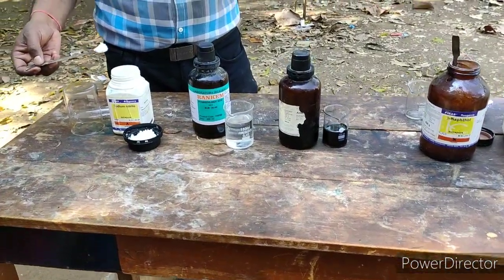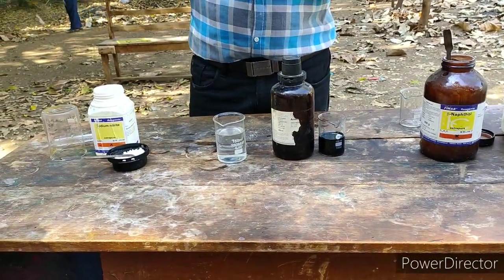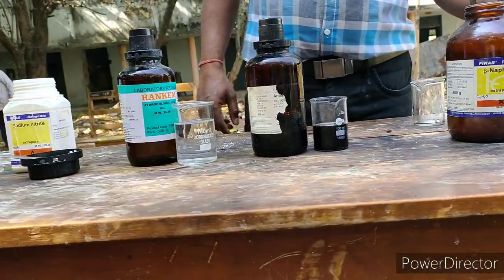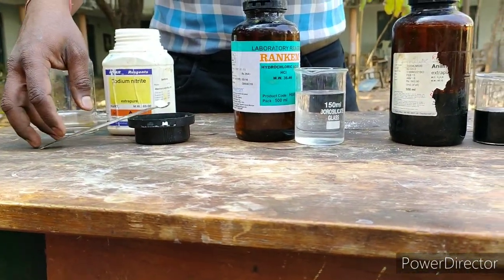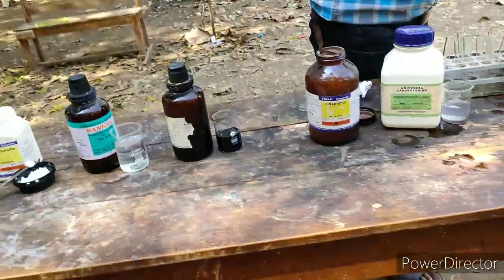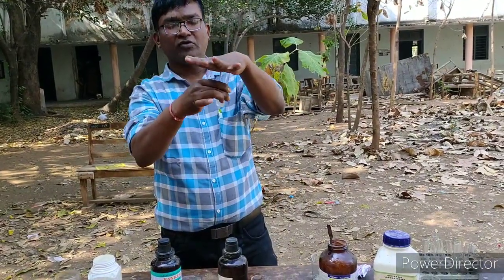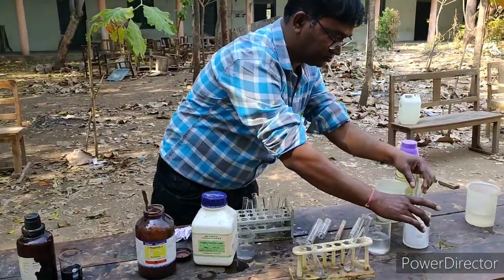For the preparation of 1-phenyl azo 2-naphthol, we require five chemicals: first, sodium nitrite; second, hydrochloric acid; third, aniline; fourth, beta-naphthol; and fifth, sodium hydroxide. First, we take sodium nitrite in a test tube in a large amount — because even if nitrous acid decomposes, having excess helps — we add water and make it an aqueous solution, then keep it in ice water.